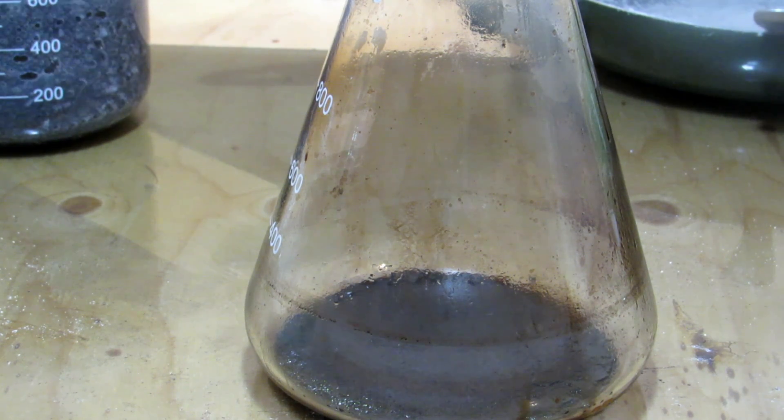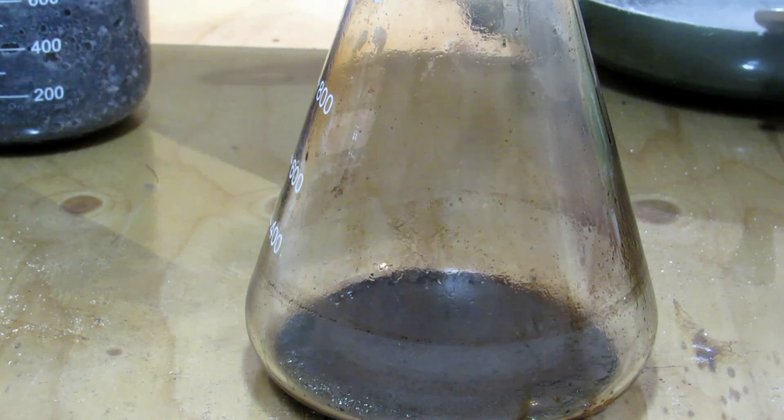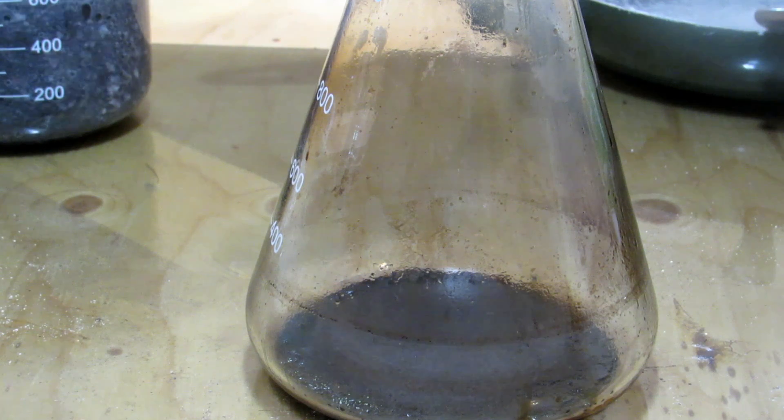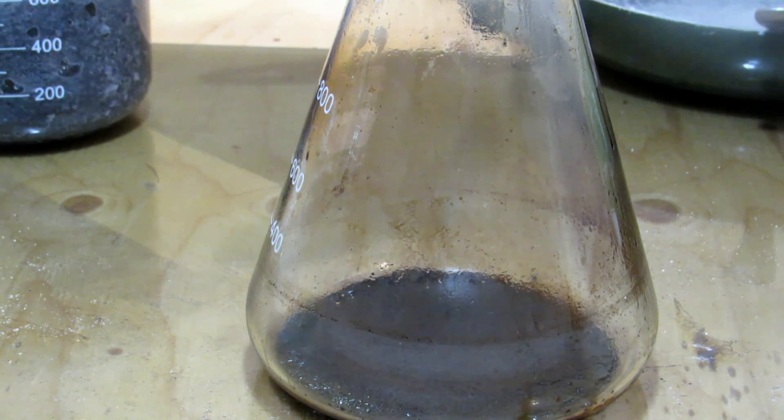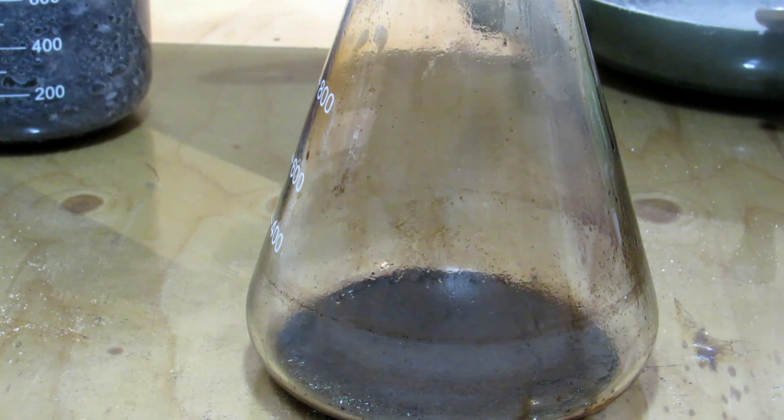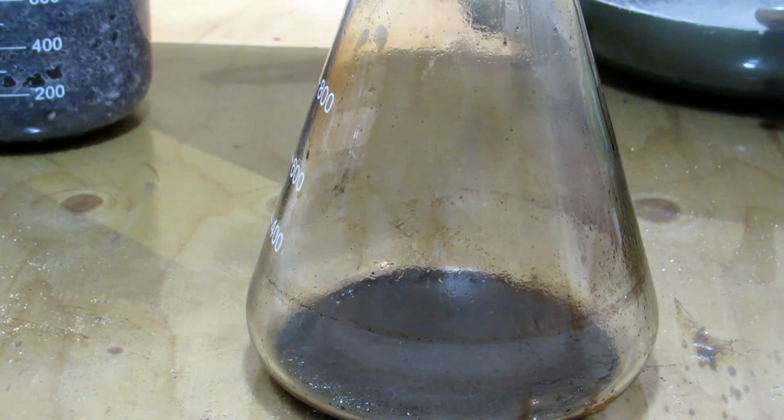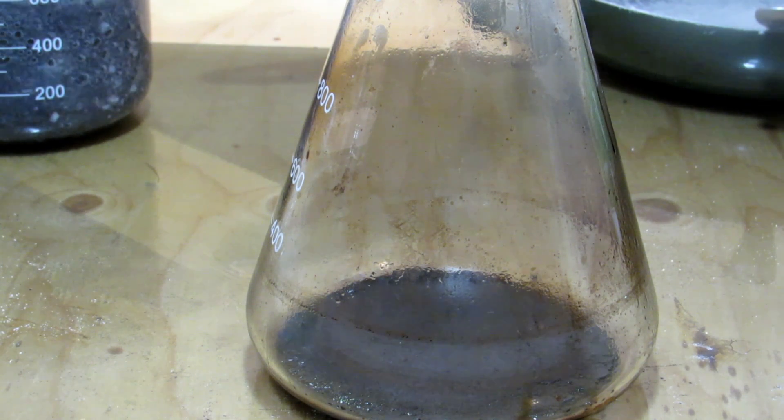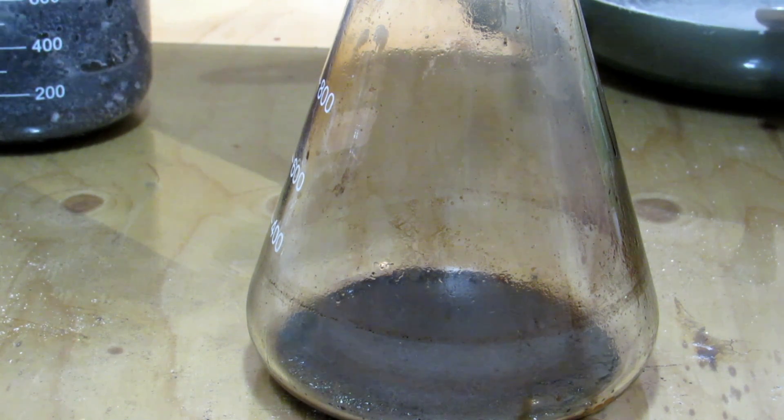Caffeine sublimates, so I was thinking sublimation. But whatever this organic stuff is in here that's an impurity, it needs to be gone. We're going to be taking some 95% ethanol and re-dissolving caffeine in some ethanol. Hopefully the other organic stuff will be insoluble in the ethanol. Alternatively, besides ethanol, we might try water. Because hot water actually will dissolve caffeine quite well, and then cold water, caffeine is quite insoluble. I'll try a couple things and tell you exactly what I do.